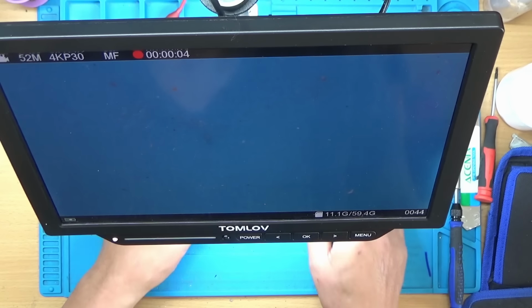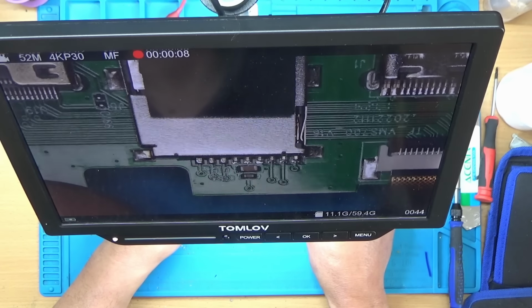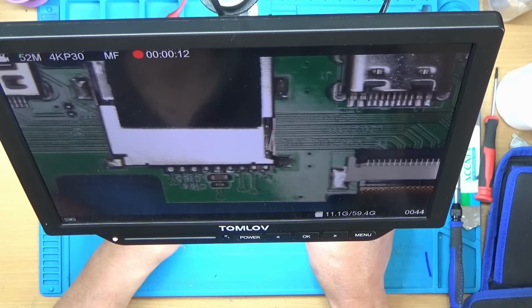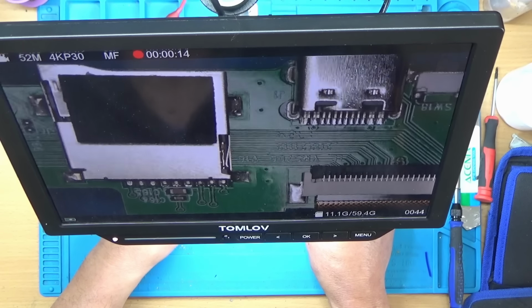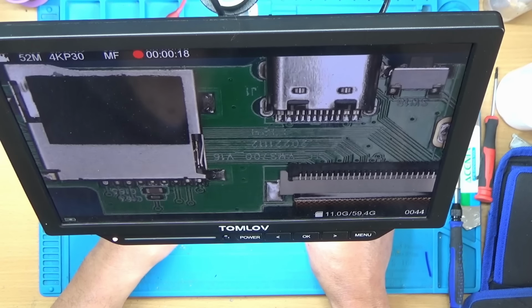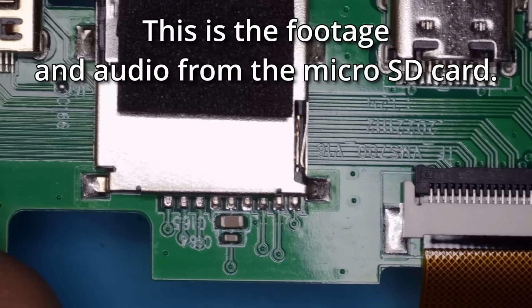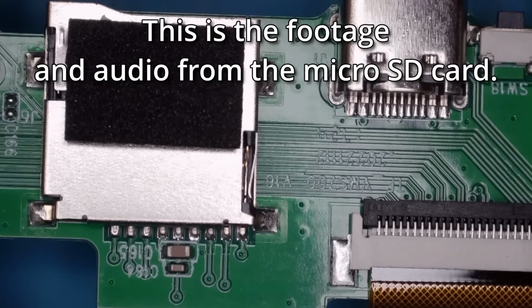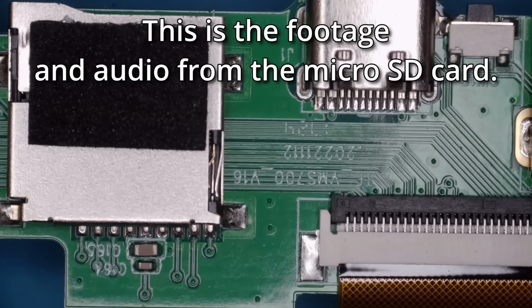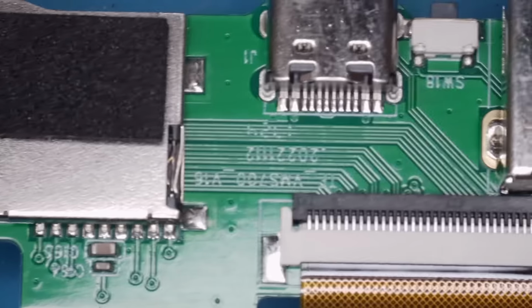Right, got it all back together. So hopefully it's recording sound now. So testing 1 2 3, testing 1 2 3. So what I'll do, I'll pop the SD card in the computer and we'll just check that it's actually recorded something. And that's the board that I've just taken out there.